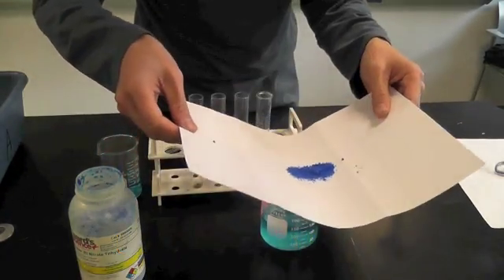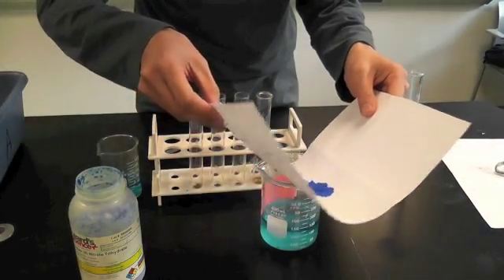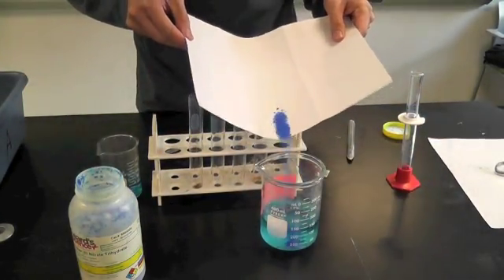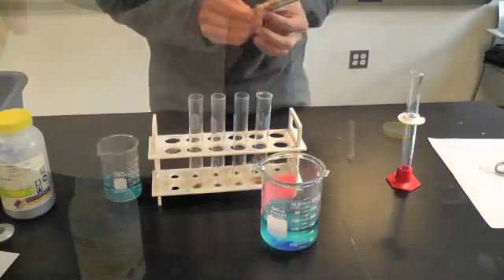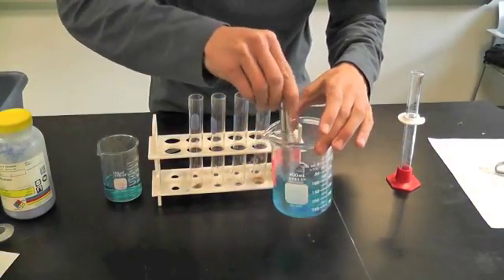And you're just going to dissolve it into some water. Here, I have some made already here, but no harm in dissolving some more. Of course, you're going to mix it up to make an aqueous solution.